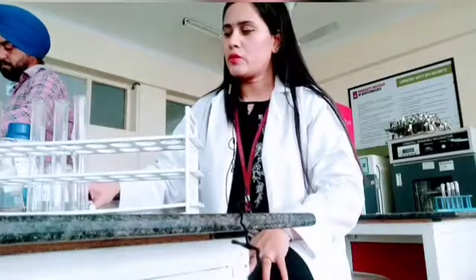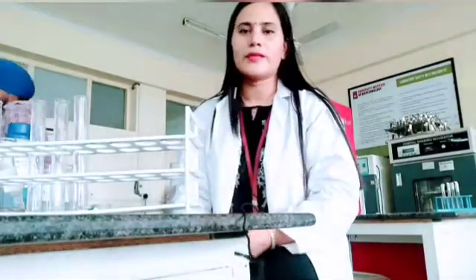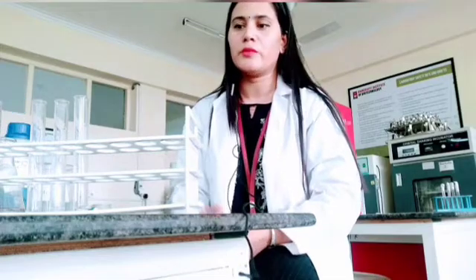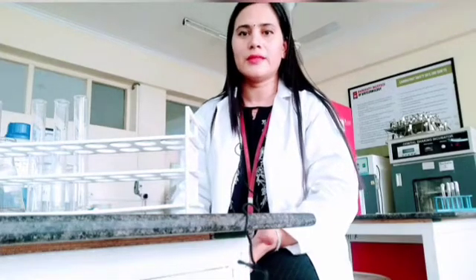So next work is to take Benedict's reagent, because this test is very simple. First you have to take sample and then you will take your reagent. You will mix them both and then you will keep these test tubes in boiling water bath for rigorous heating, and you will observe for the PPT formation.